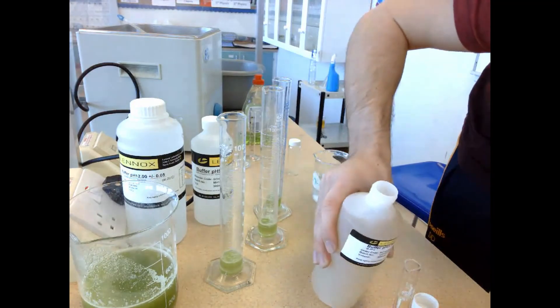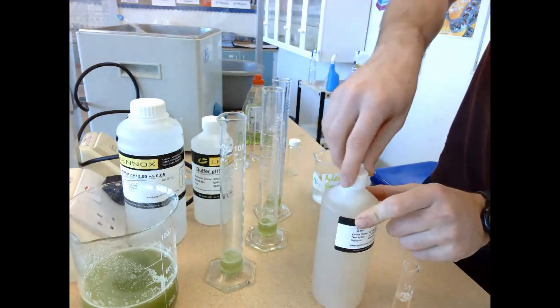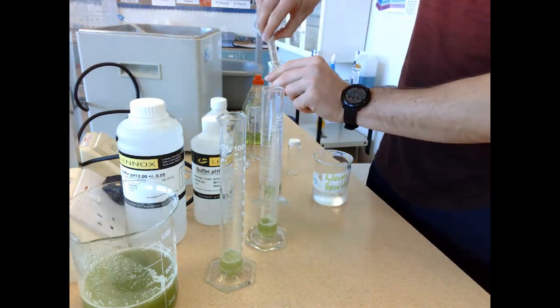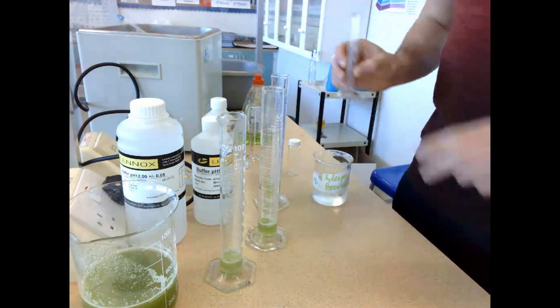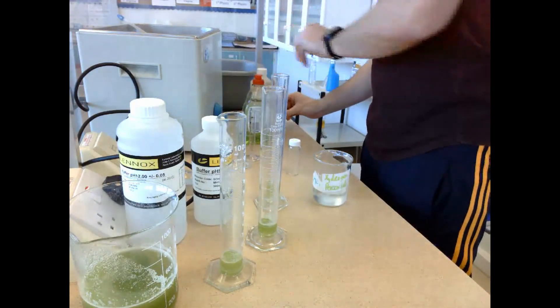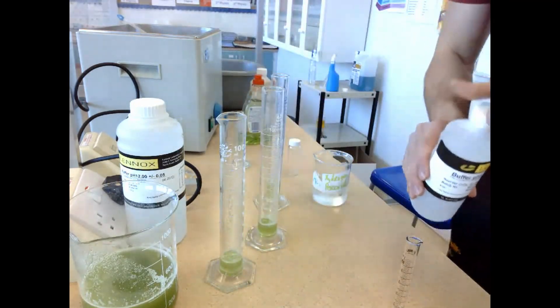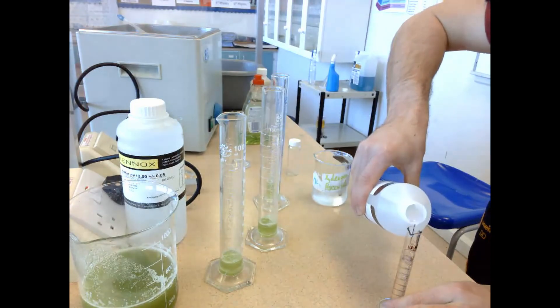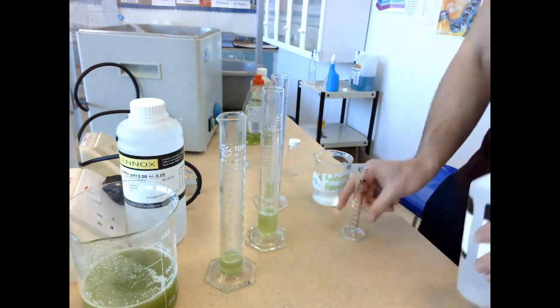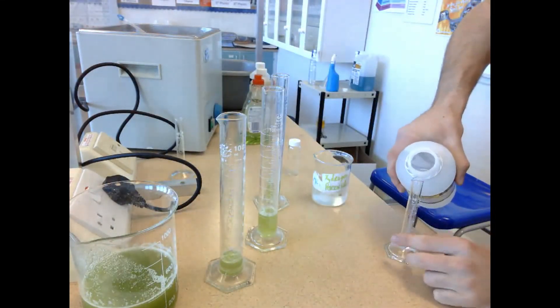There's going to be no reaction to begin with because the reaction won't start until I've added in the hydrogen peroxide later. So there is pH buffer 3 added into the furthest away graduated cylinder, and then I'm going to do the exact same thing with pH buffer 9 and pH buffer 12. The pH buffers maintain the pH throughout the reaction of this enzyme.